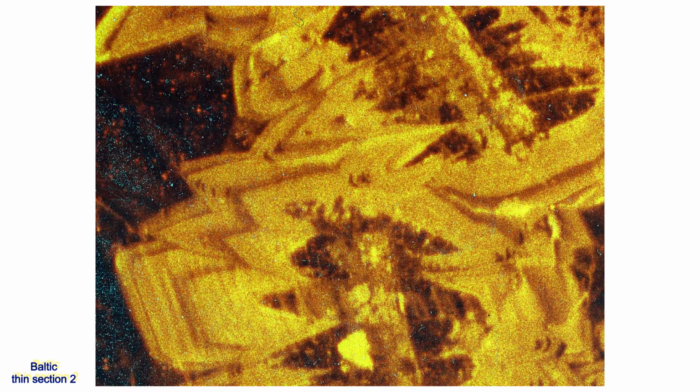A cathodoluminescence image of the same area shows the same features as the stained image, but they are better defined and some additional features are shown. The area around the center of this image is enlarged and interpreted next. The different cathodoluminescence areas are traced to produce a simplified sketch.